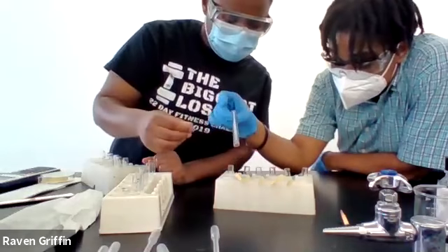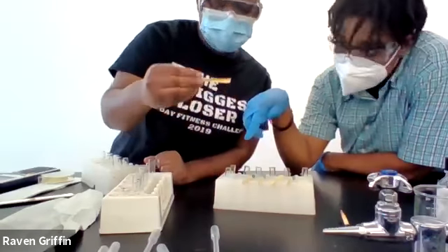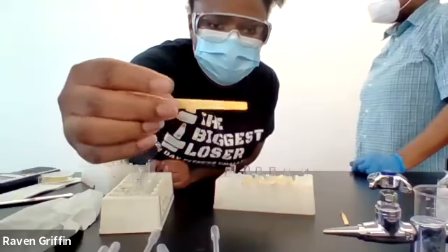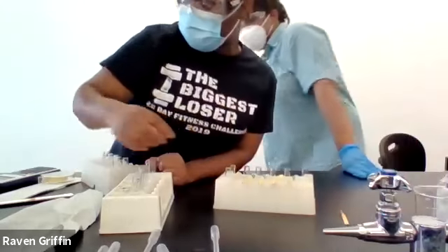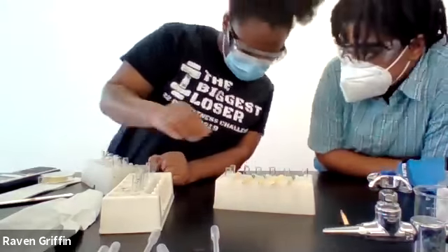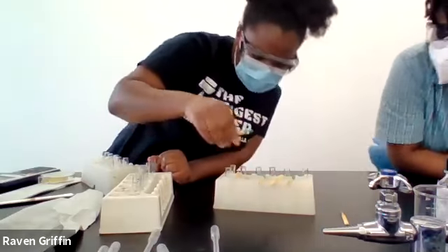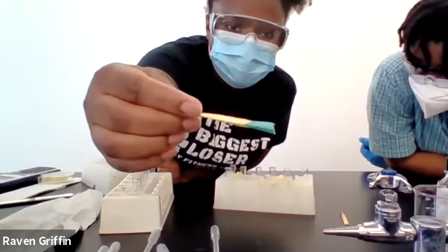Sodium hydrogen carbonate. That was the last one we did. And that's like a yellow orangish color. What's next? So yeah, Na3PO4 is like this greenish color.